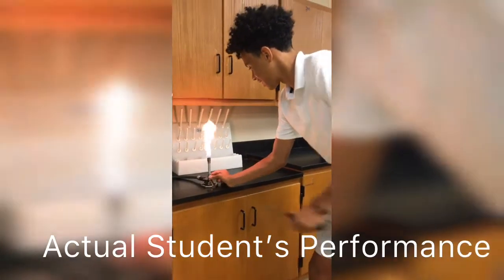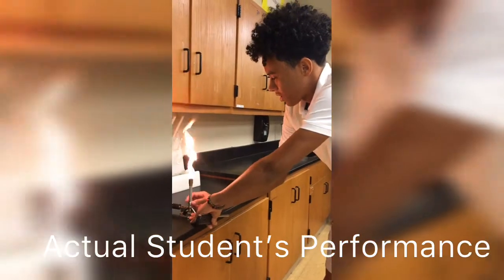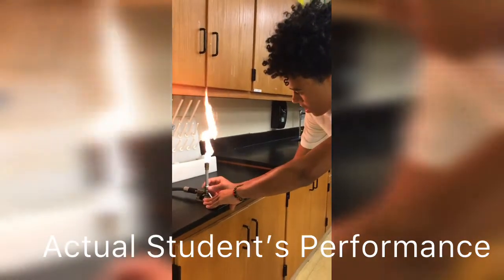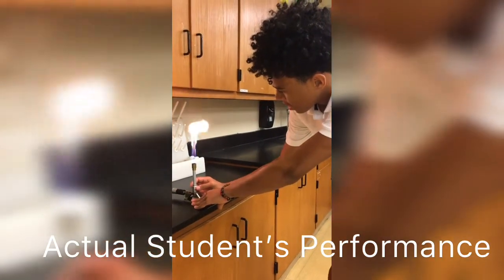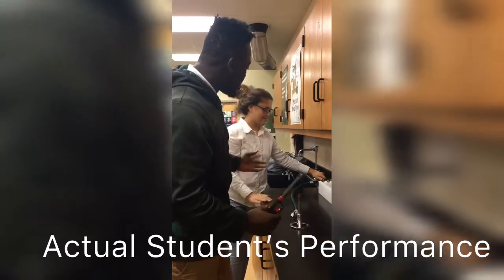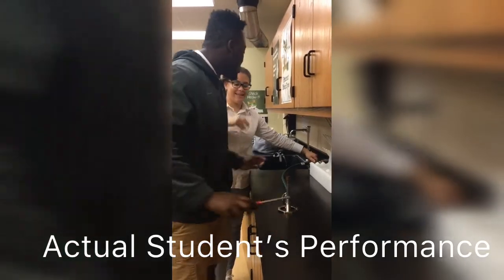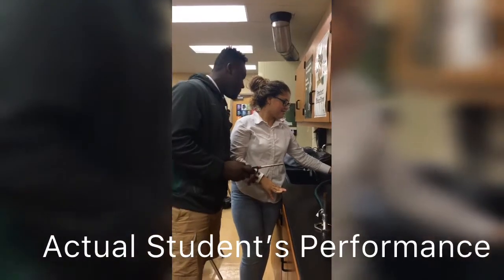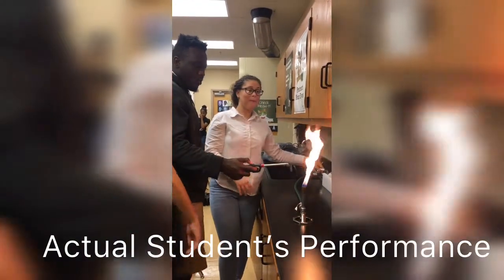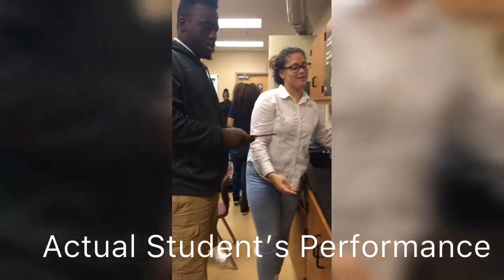Adjust the air hose. Hold the base. Make sure everything is tight. Then open the gas a little bit — you have to have the fire. Then adjust the air hose to get your flame.